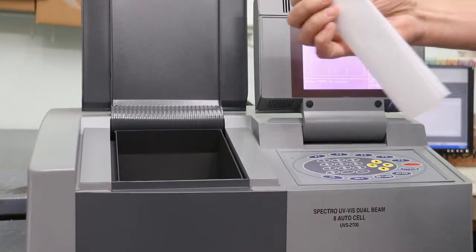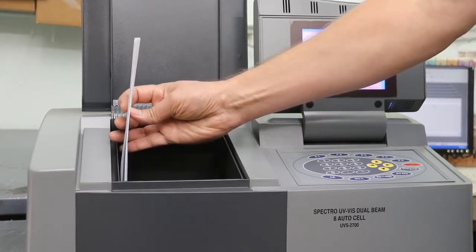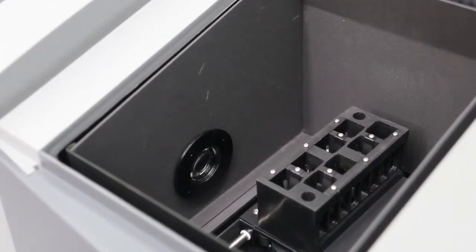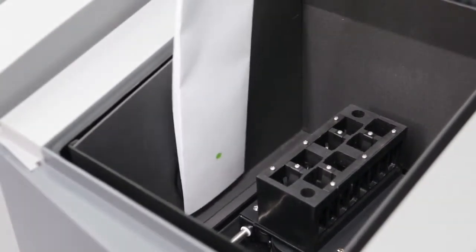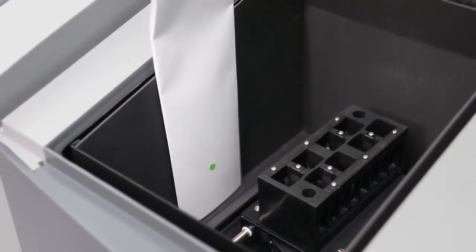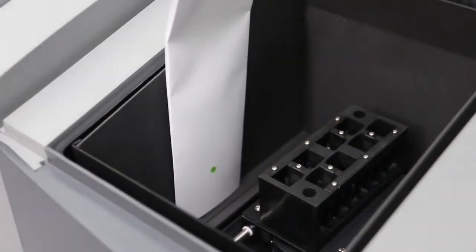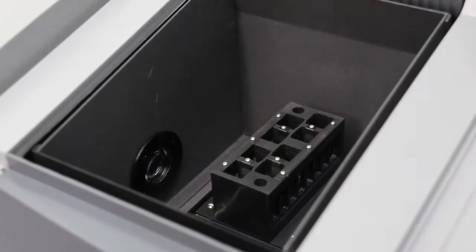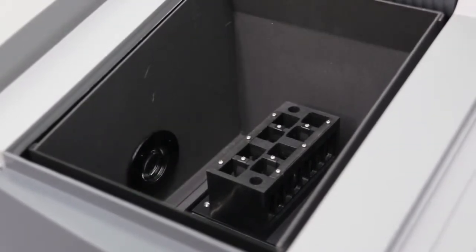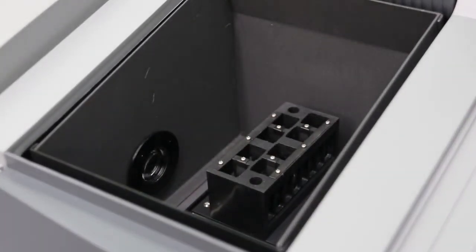Take a piece of white paper and place it down in front of where the light enters the sensor. In order to see the light, the room should be dark. Place the paper in front of the sensor and you will see a small green dot. That shows you that the sample holder is not blocking the light. If you do not see the light on the paper, the light is either being blocked by the sample holder or the light is not on the slit.